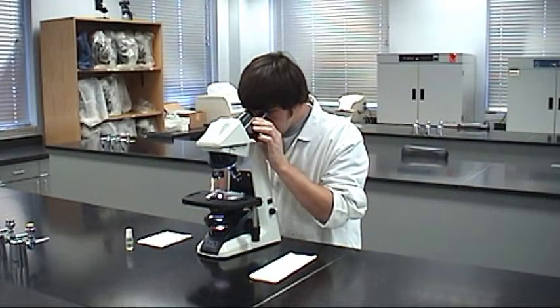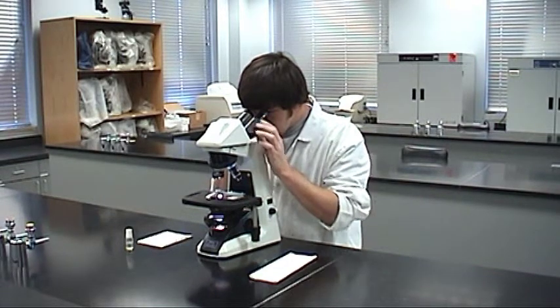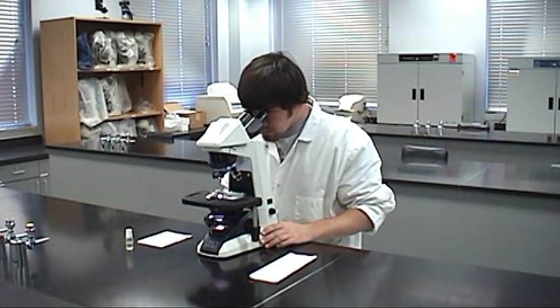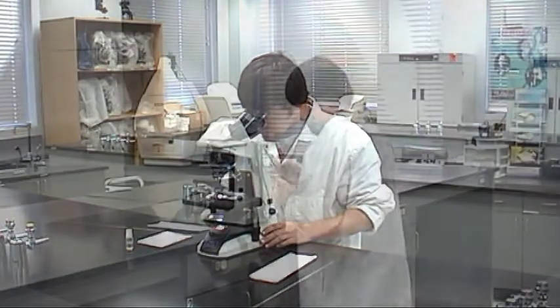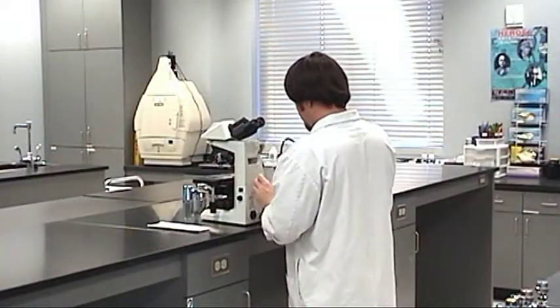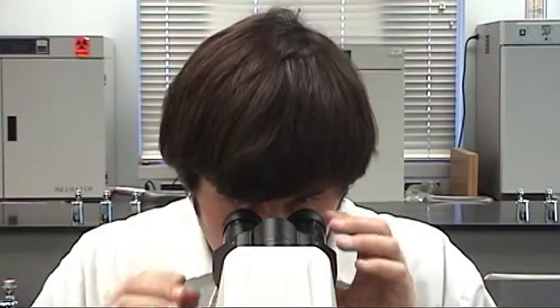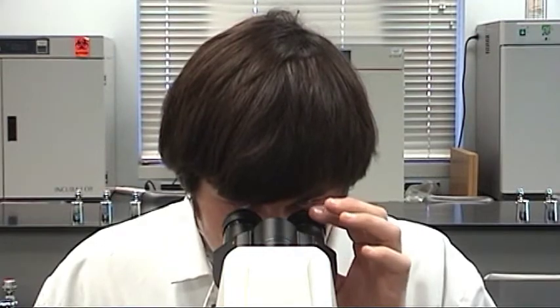The microscope is a useful tool when you know how to use it effectively. In this video, we demonstrate how to set up a microscope and basic techniques for viewing a specimen.